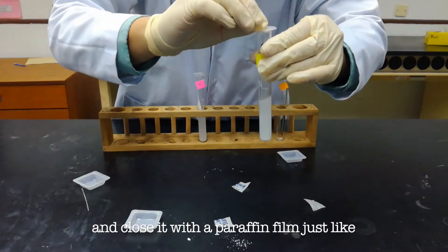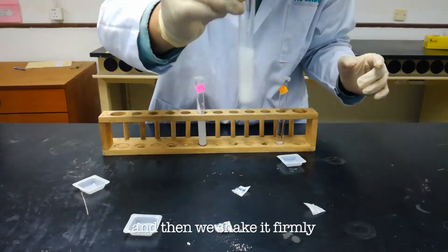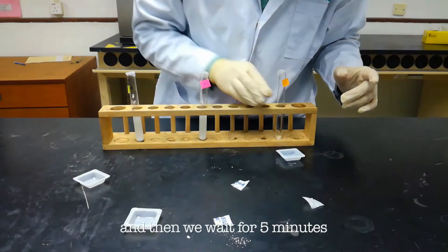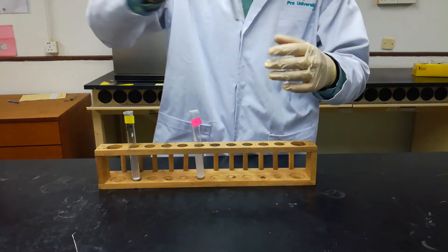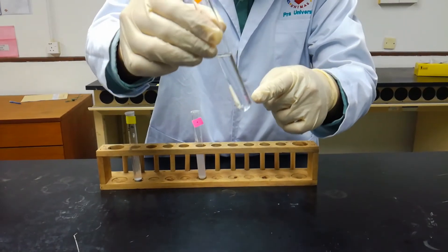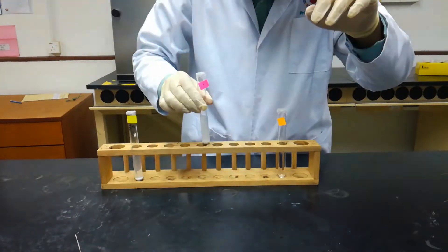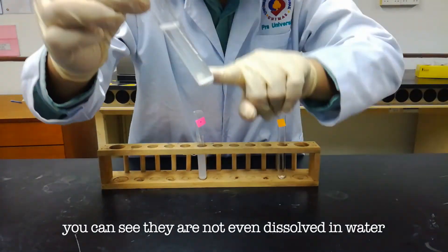I close it with a paraffin film, and then we shake it firmly. Then we wait for 5 minutes. After 5 minutes, we observe that magnesium sulfate has completely dissolved in the water. The calcium sulfate is partially dissolved in water. But for strontium sulfate, you can see it is not dissolved in water at all.